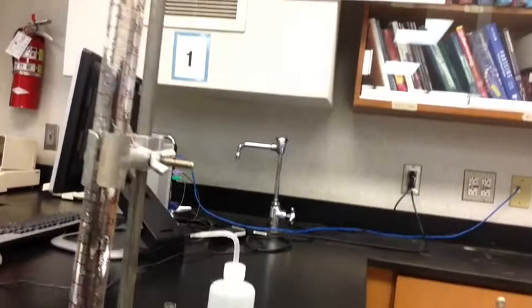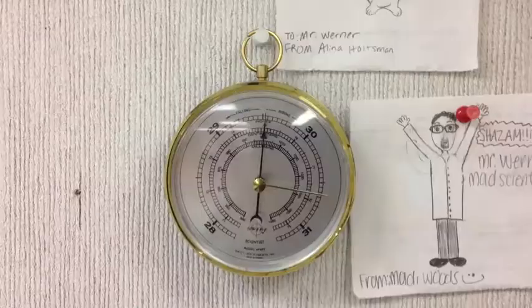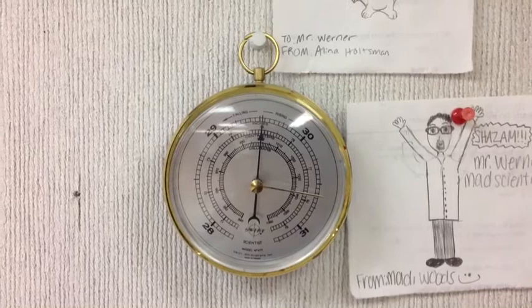You can see there were no gas bubbles in the top at first, but gas is starting to come up from the reaction between the magnesium and the hydrochloric acid. At first it's just a few bubbles here and there, and then it starts going like crazy. You're going to get all those bubbles — that gas is being collected, and you can see it starting to accumulate.